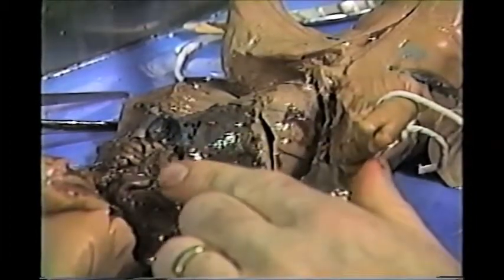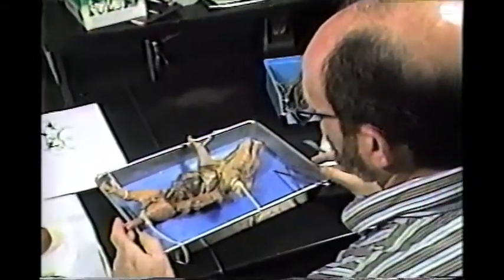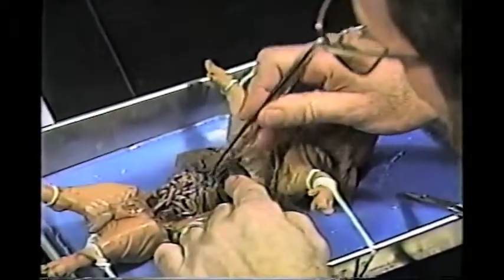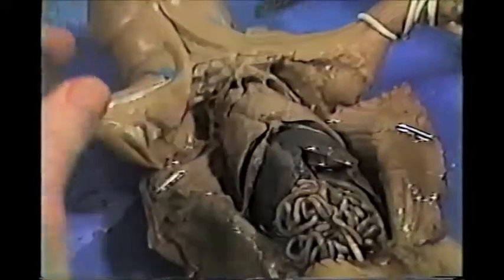Okay, what I think I'm going to do now is stop, and we'll put this under water and wash out all this debris so you can see the abdominal structures. All right, we've washed out a lot of the abdomen, and I think you can see the organs much better. You can see some of the blue dye has leaked out. This is that latex that I was talking about. So if there is some still left after you wash it out, you can just pick it out like that. Let's go back up to the throat area, and I want to clean this out, and then we'll go over the structures.